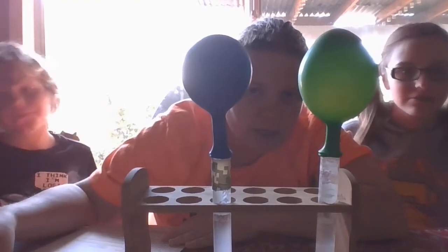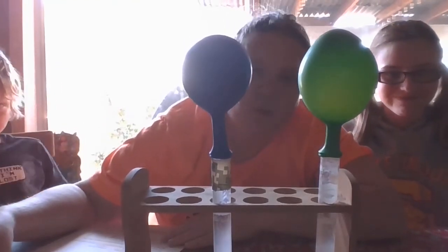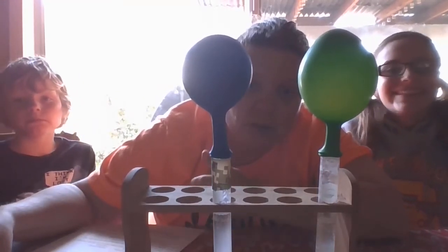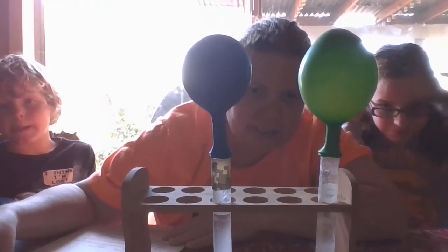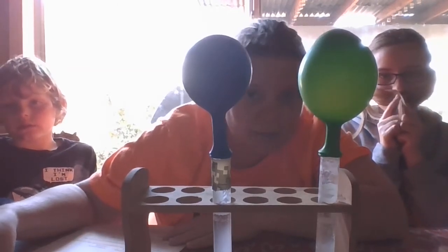What the heck is catalyst? Stop talking. We are going to go over and get this ready, but make sure you've got all your questions answered, and we're going to move on to experiment 4. And you guys are going to see what the catalyst is, okay? And you get to watch me kind of start to make it.